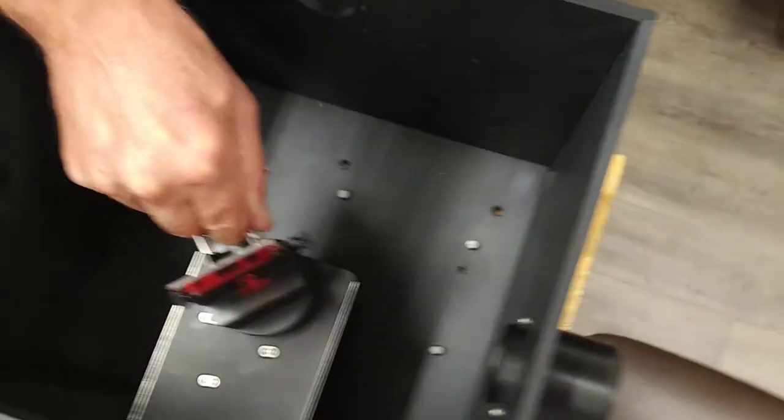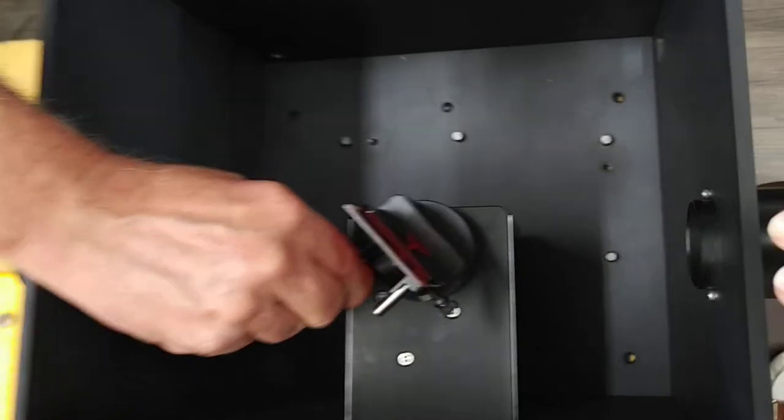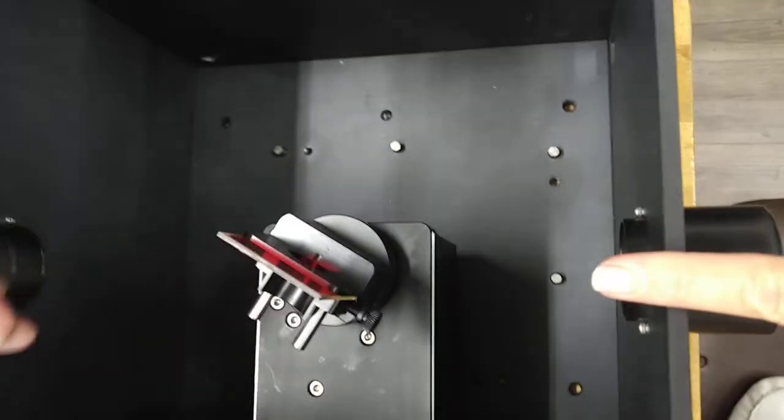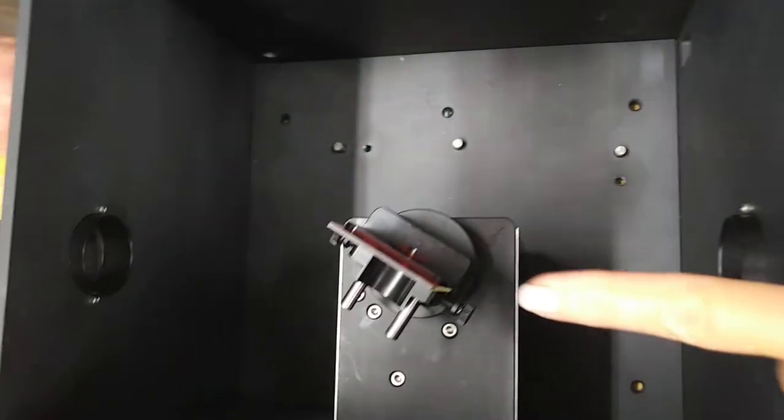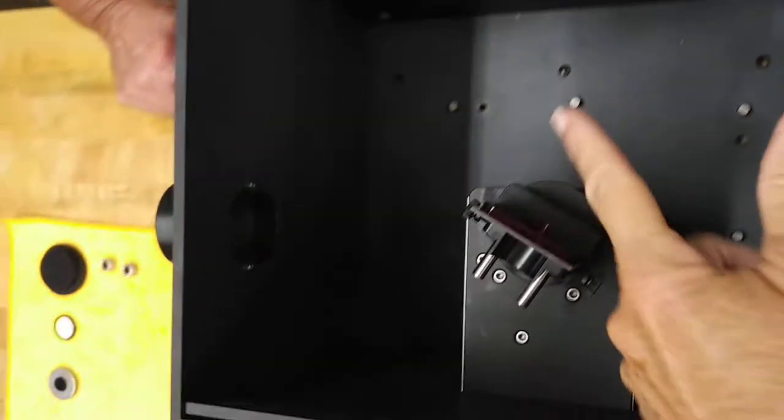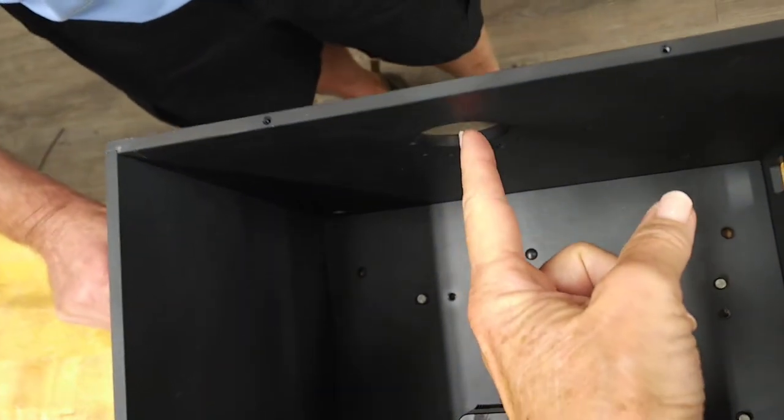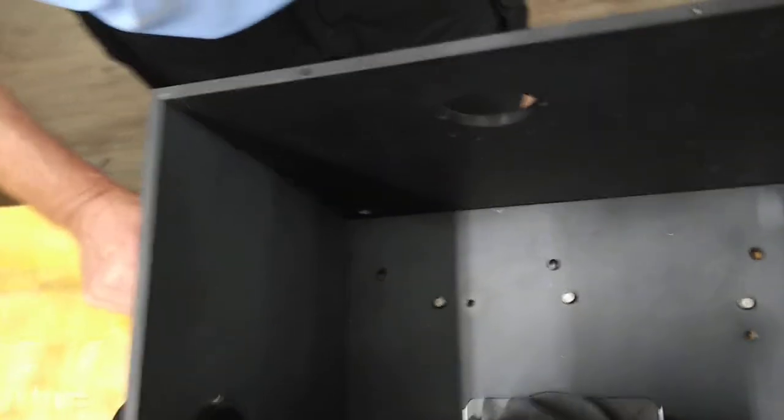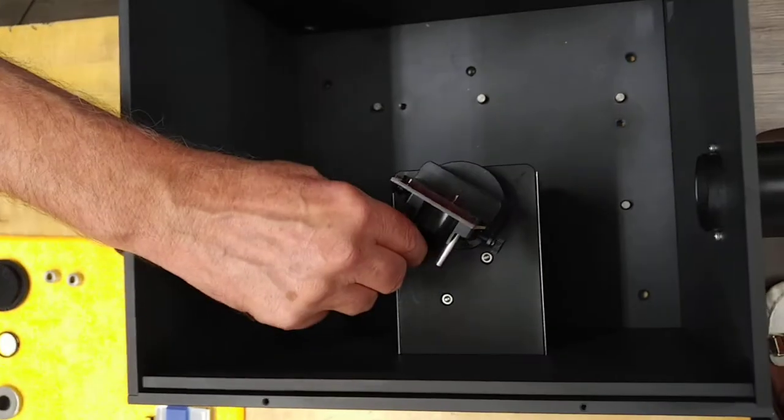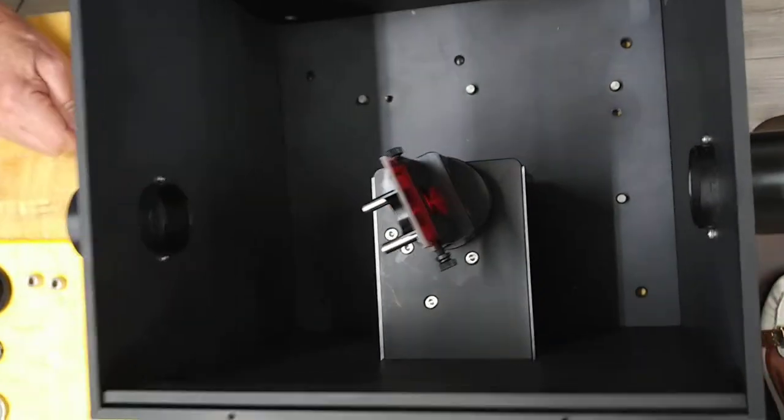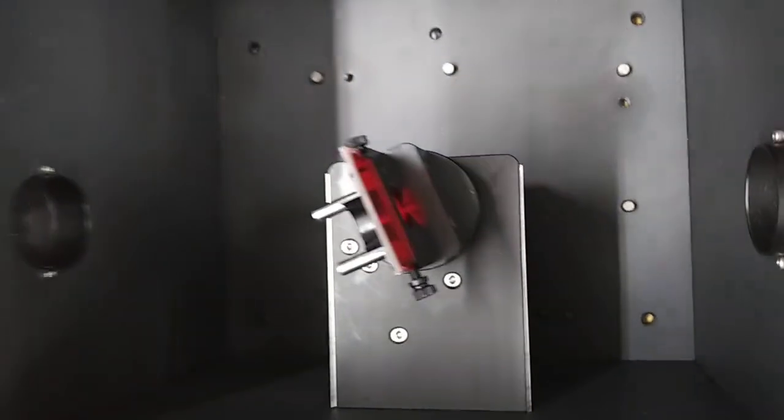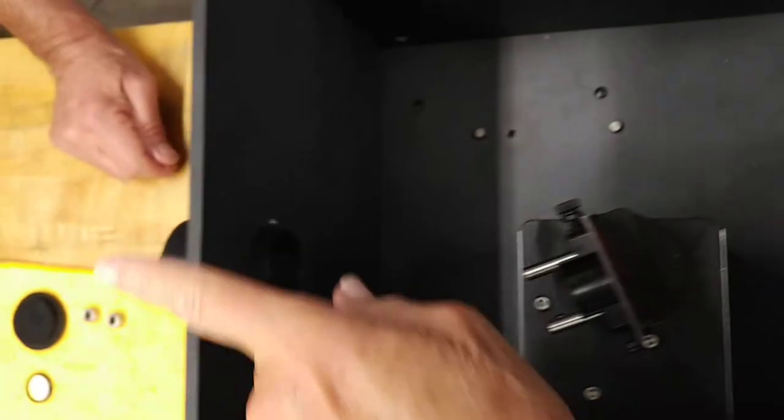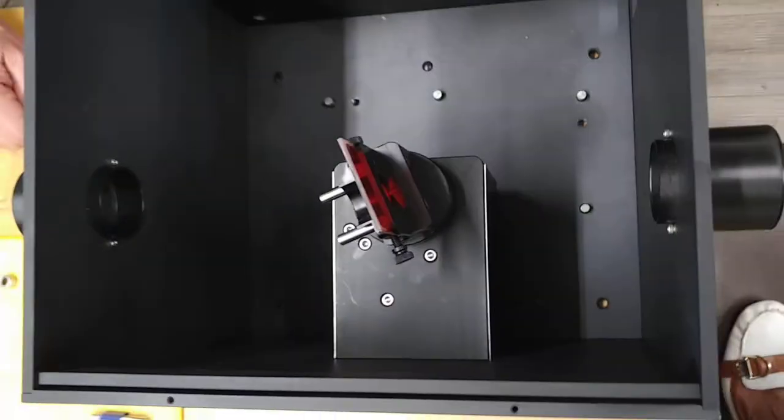In this instance we are sitting such that our light would be coming in from this side and either hitting the sample and reflecting out to a detector here, or Rich, go ahead and rotate it so that it could be a transmission measurement. It would travel from this port straight through to a port over here.